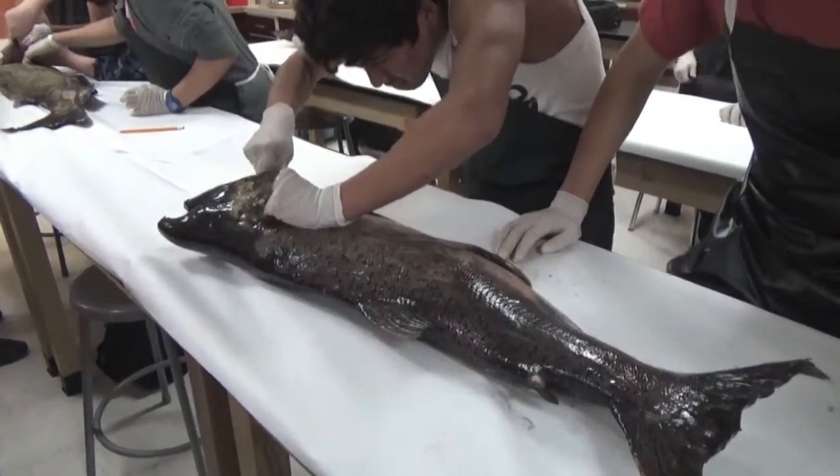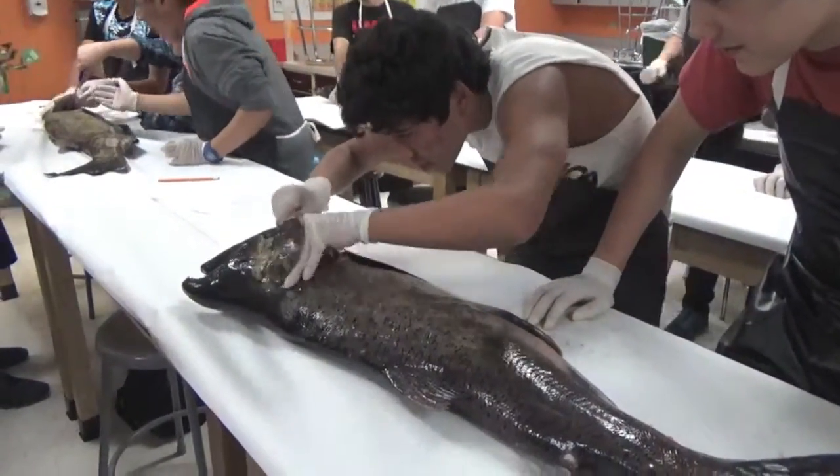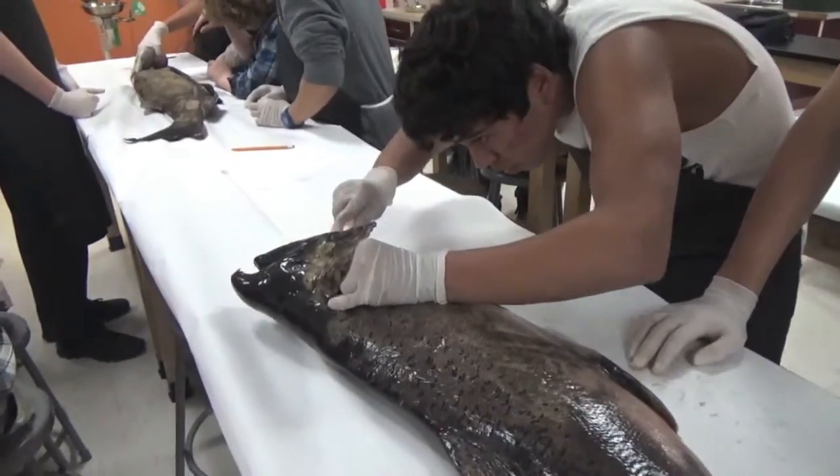Let your neighbor help. It looks like you guys are cutting a little too much — it looks like it's not even being done right. You're cutting all of them at once. No, he's cutting one at a time.